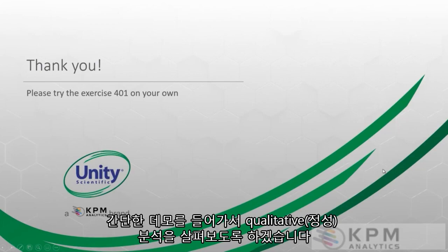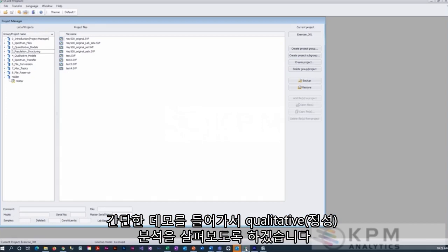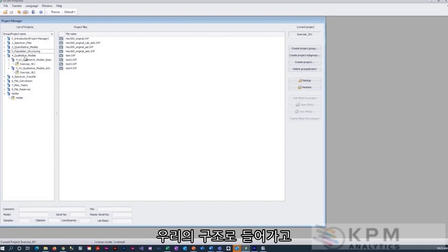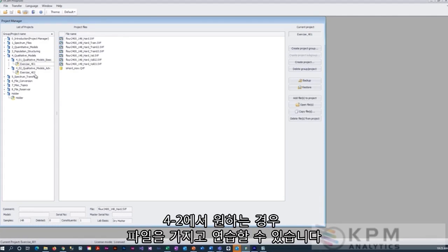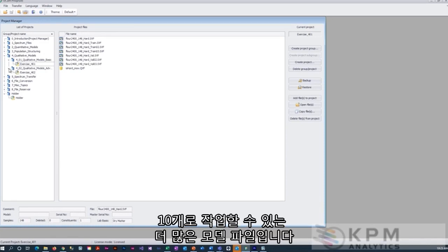Okay, and with that, let's jump into a real quick demo and take a look at qualitative analysis. If we open up UCal 4 and go into our structure here under qualitative models, we can go into a first exercise. You can play around with the files if you'd like in 4.2. We do not have an exercise for that, but it's some more model files for you to work with.